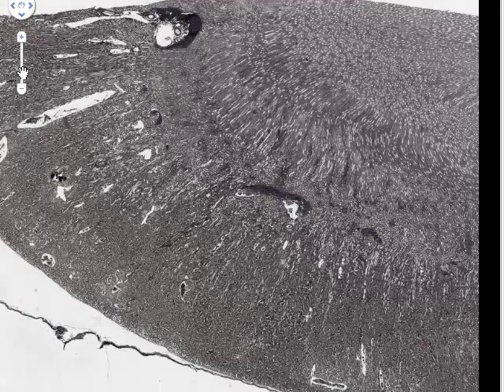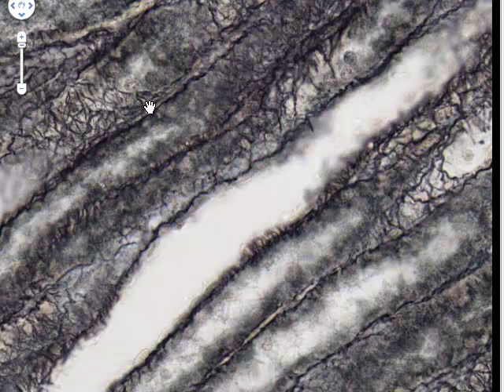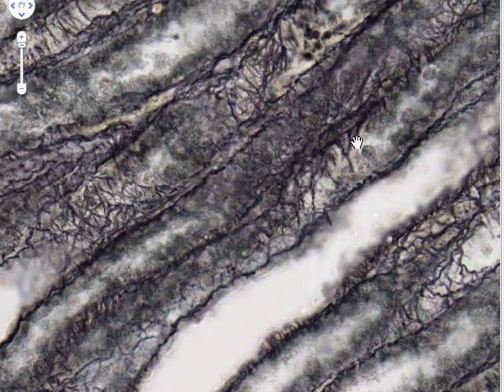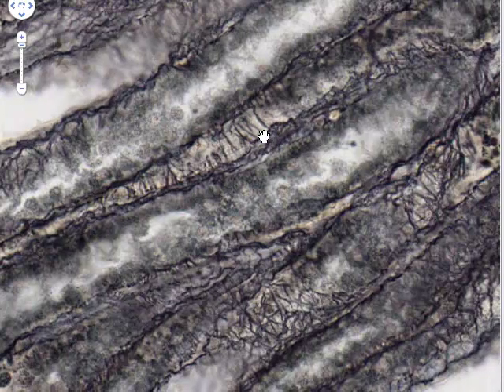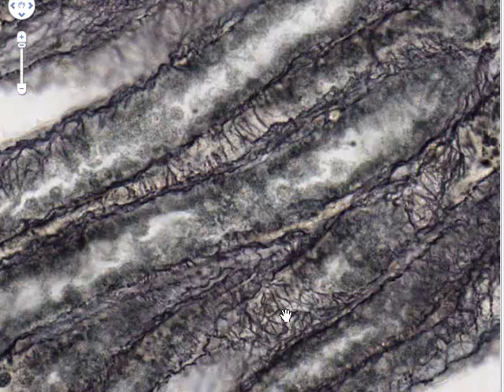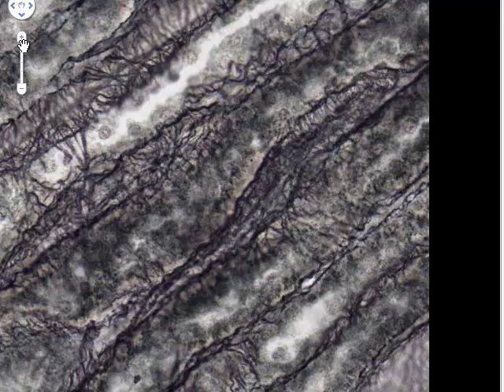You can look for reticular fibers anywhere within this section. Increasing magnification, I'll find a region with tubes cut in longitudinal section. Reticular fibers are characteristic in organs with small diameter hollow tubes, because they form a scaffolding, meshwork, or supporting framework on which epithelial cells and other cells can attach. Here alongside a tube, you can see these black structures — reticular fibers — running parallel to the long axis of the tube and also at right angles around its periphery, forming a dense meshwork that supports the tubular organization of the kidney.